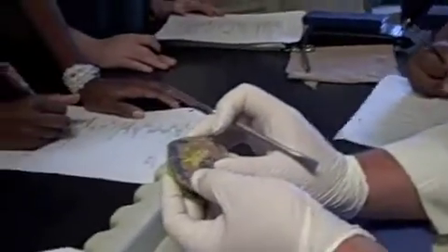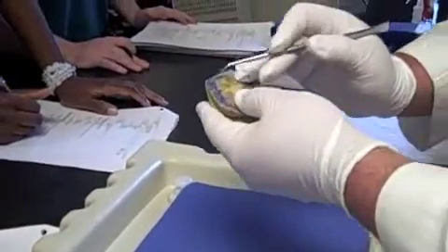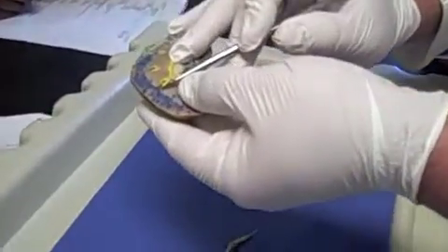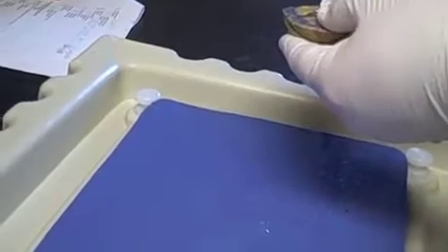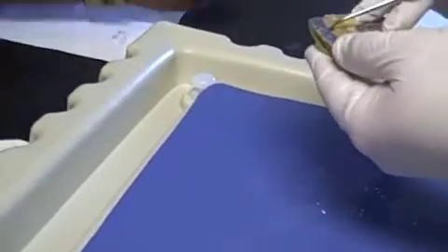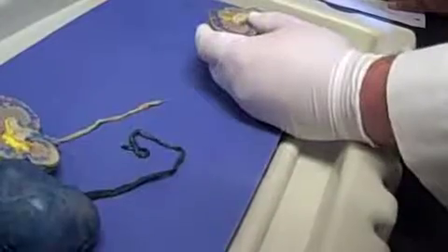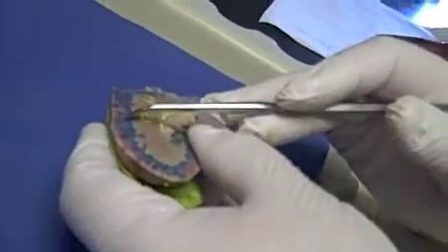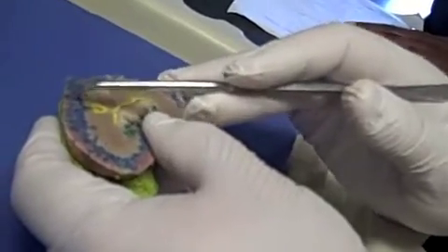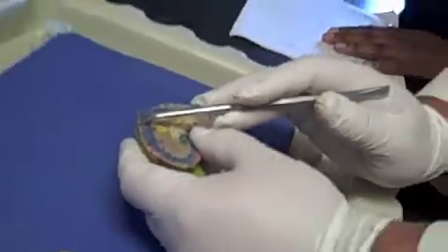Okay? The interlobar arteries are going to branch off to give rise to other arteries called arcuate arteries. These arcuate arteries basically wrap around each one of the renal pyramids. Okay, so here's a pyramid, and we have an arcuate artery wrapping around. We have branches coming off of the arcuate arteries right there called the interlobular arteries, and the interlobular arteries run up here into the cortex. Right, so that's what all these little red guys are right there.